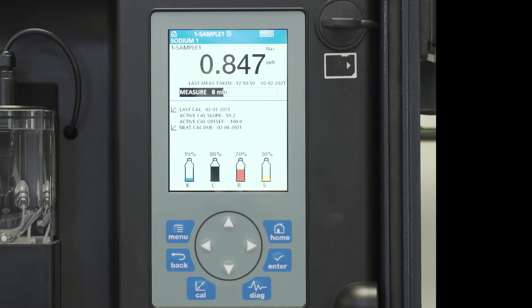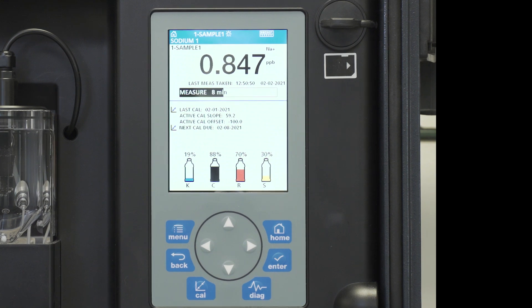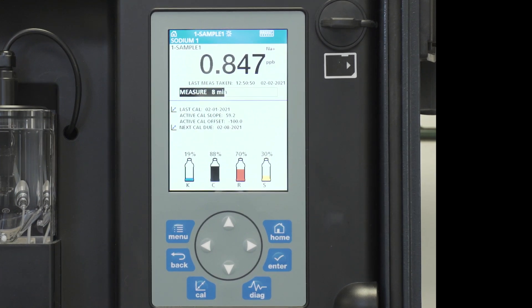In this example, we're going to set up the instrument for automatic reactivation and set it up to happen on a Monday and a Thursday at 1 a.m. in the morning.